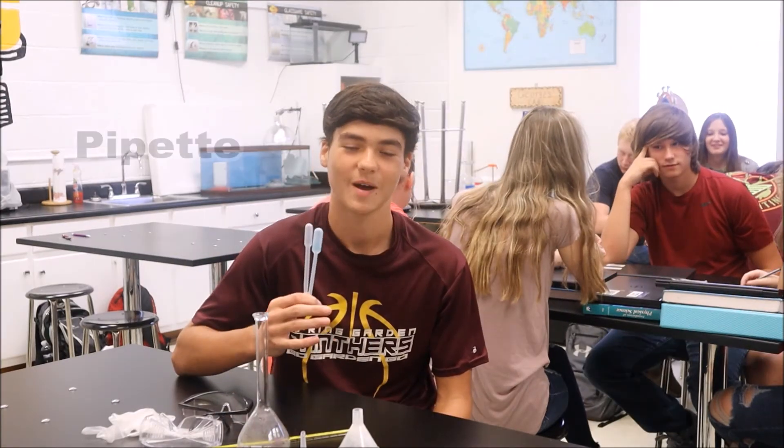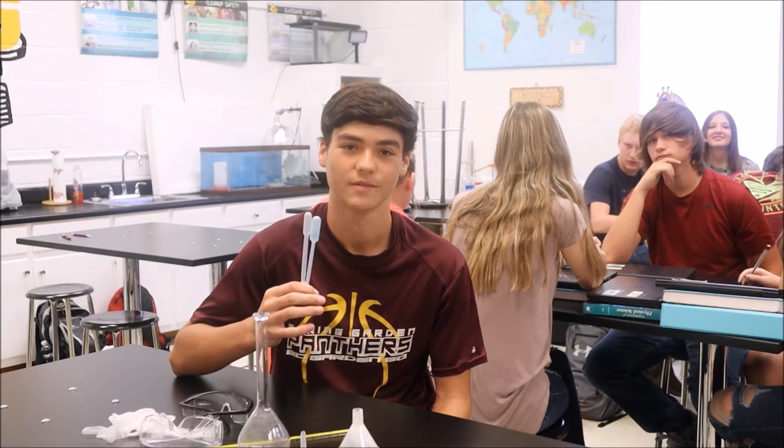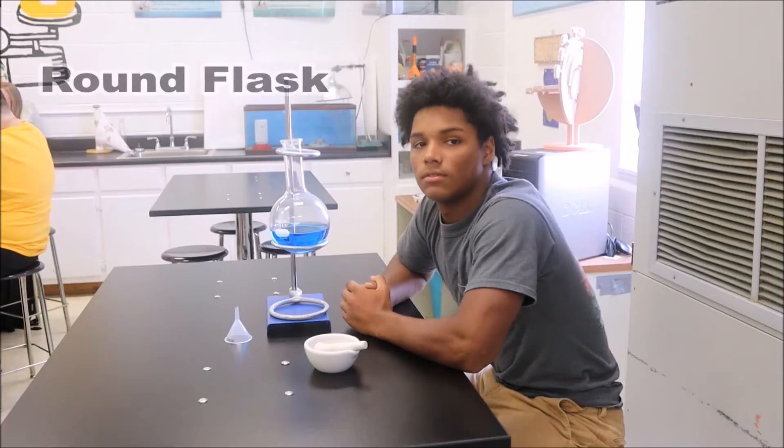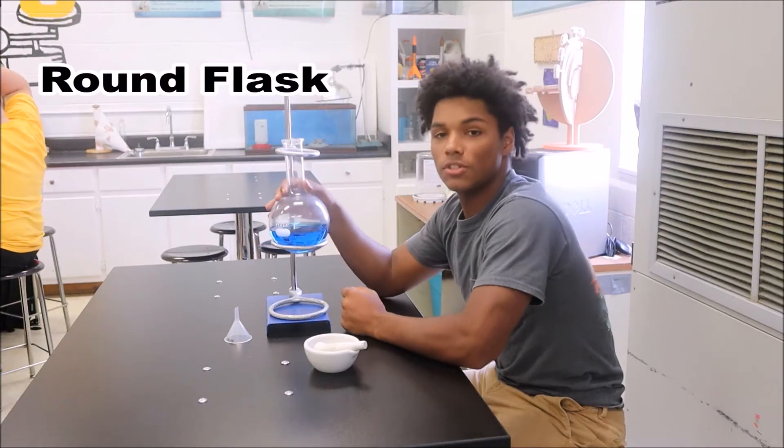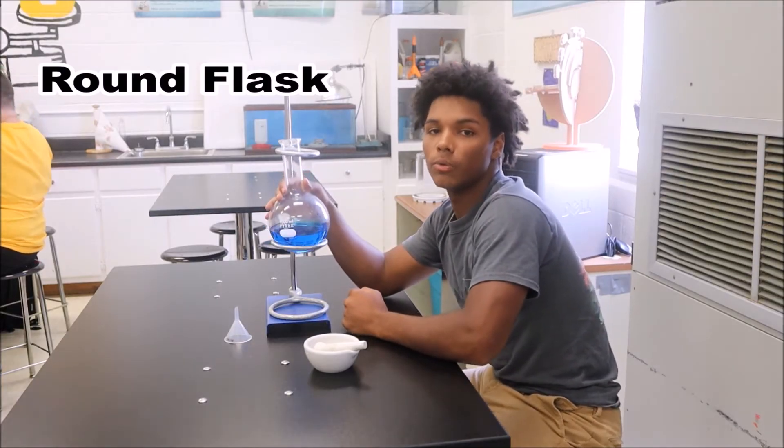These are pipettes. Pipettes are droppers used to move a fixed amount of liquid from one place to another. This is a round flask. It's used for boiling liquids.